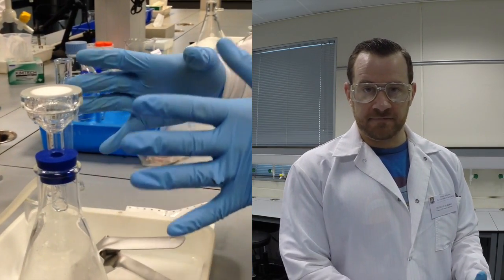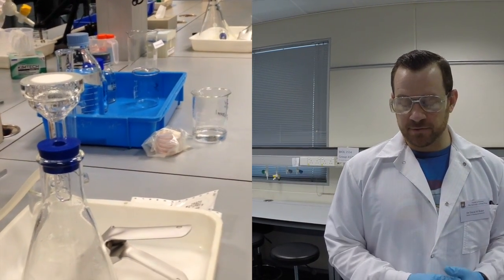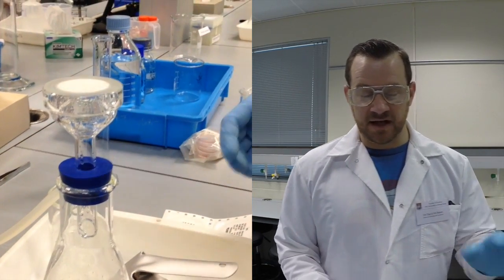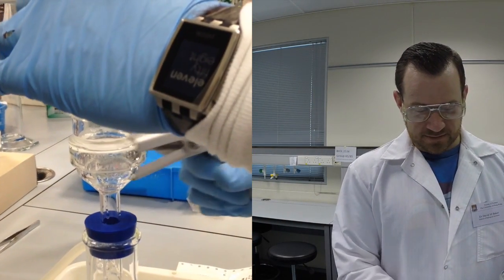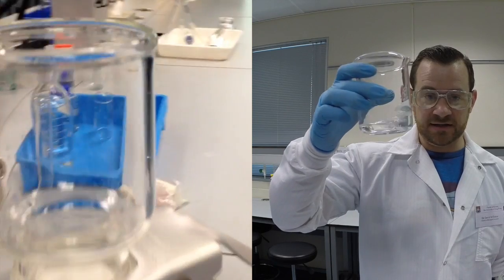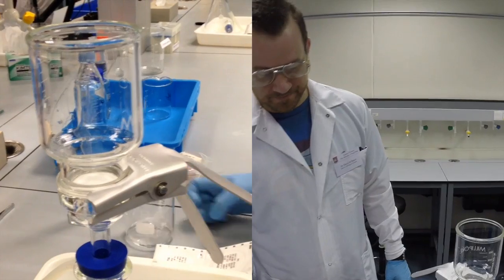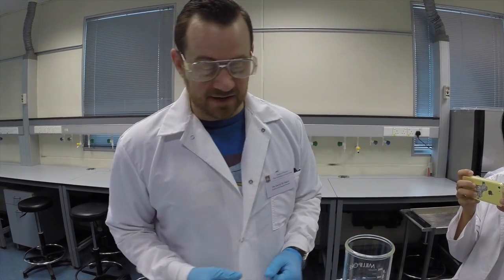So I have my vacuum filter apparatus here that I've just used to prepare the sample for total suspended solids. And since I've run some of that sample through here, I want to make sure that my system is sterile and I'm not introducing any extra microbes that are adhering to the surface of the upper part of my filter apparatus. So I'm going to connect everything together. And this is the only time you do not need to have a filter installed, because I'm going to add a little bit of very clean ethanol to the filter rig. So I'm going to pour the ethanol around and allow it to filter through. So this should sterilize the surfaces that are going to be encountered by my sterile membrane filter.